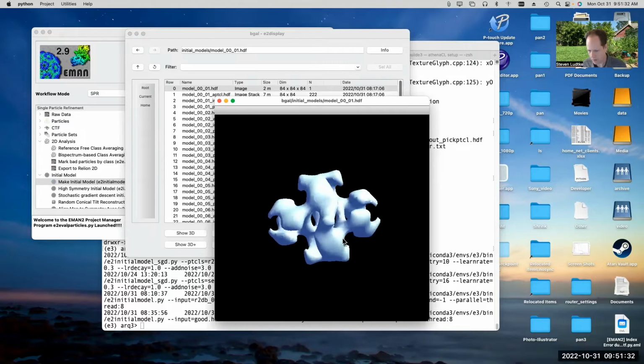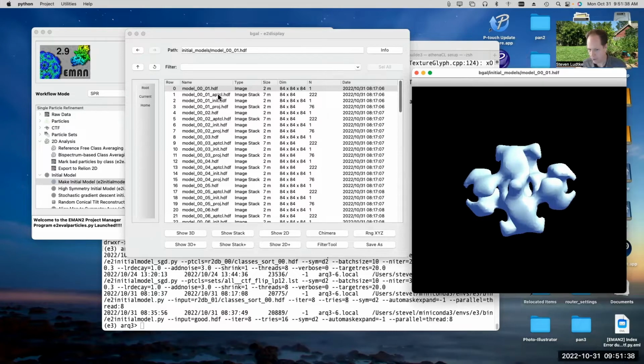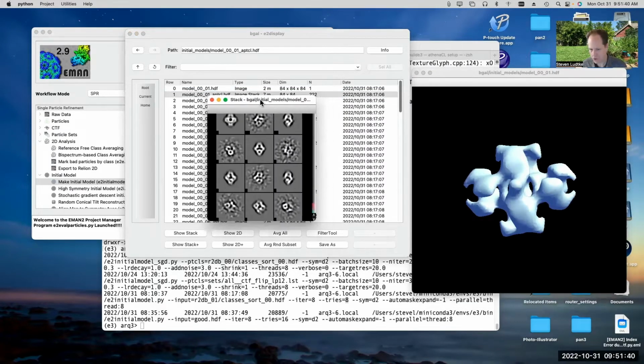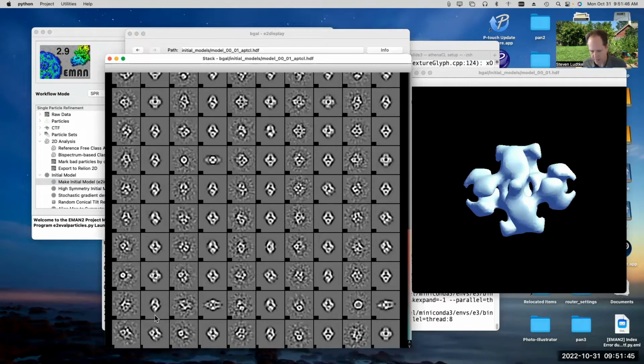So that was model 1 as an output. Actually, I usually start by looking at the A particle file, because that gives you a better picture of whether things worked well or not. The idea here is that in the A particle file you have alternating class averages and projections. So this is a class average, and then this is the projection corresponding to the orientation this class average was believed to be in.